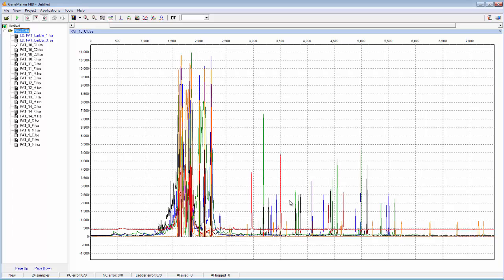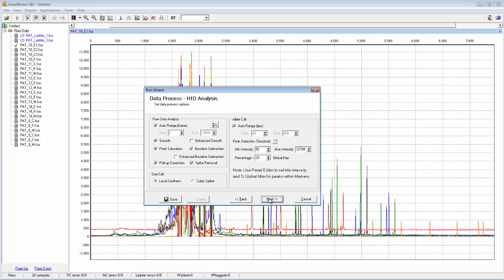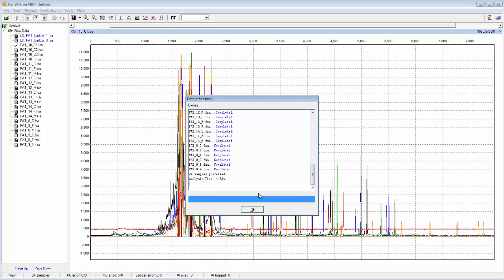So right now we're of course just looking at the raw data. I'm going to process it by opening the Run Wizard. And then I'm just going to select my identifier template because these are identifier samples. And then I'm just going to click Next, Next, and OK. And of course, if you have any questions about processing samples, that's all covered in the introductory webinar.